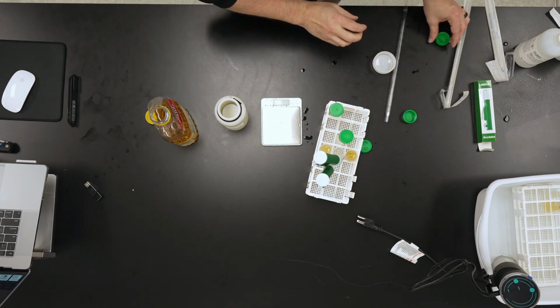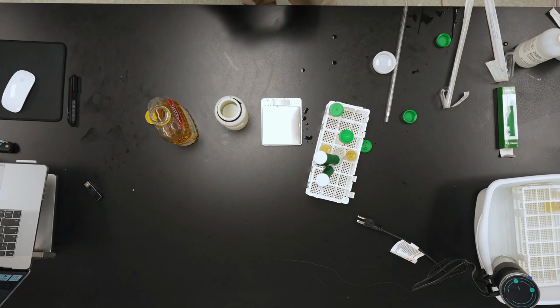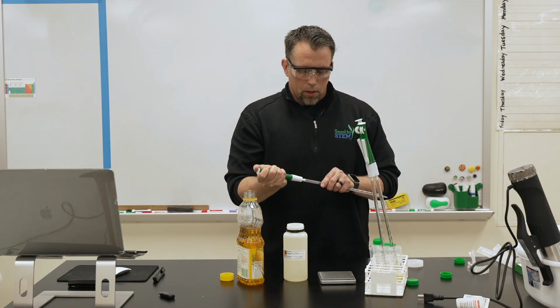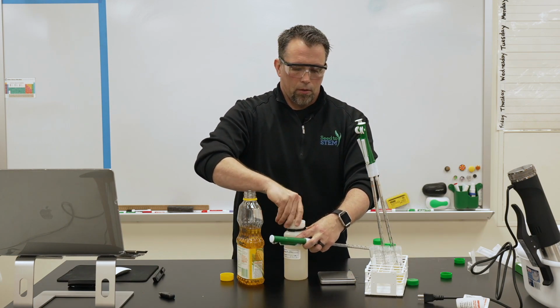And for a viscosity test, it's kind of interesting to watch, see how long it takes to flow out of a pipette. So we just use a gravity feed to drive it. This is our biodiesel. Put the lid on our renewable diesel here.